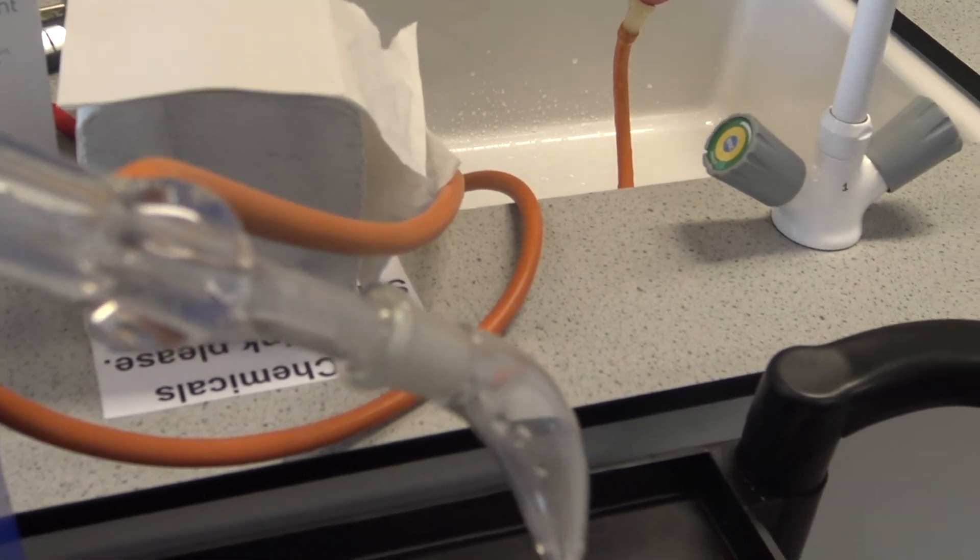Pure water is coming down, and you can see pure water has definitely formed on the side there. If we go all the way down into our beaker, let's have a look and see what we've formed in here.